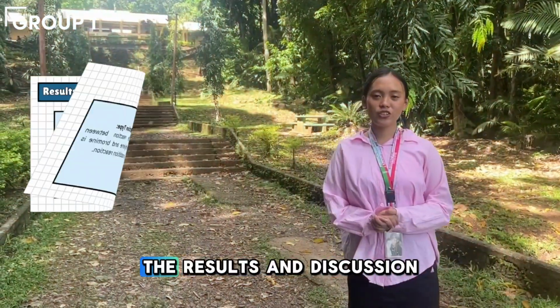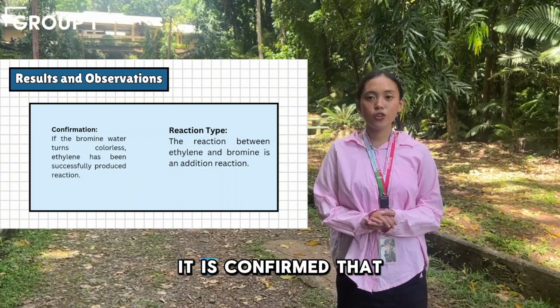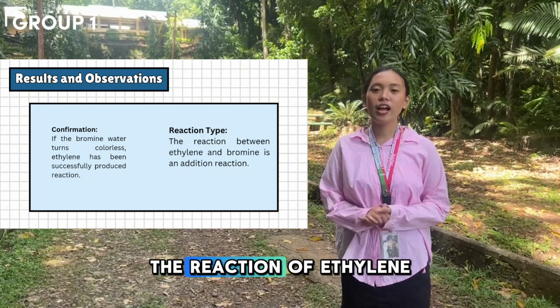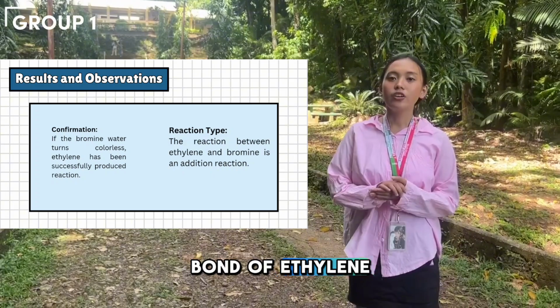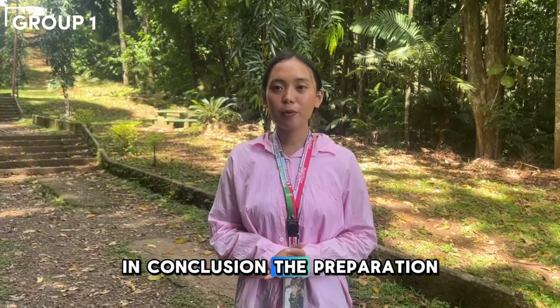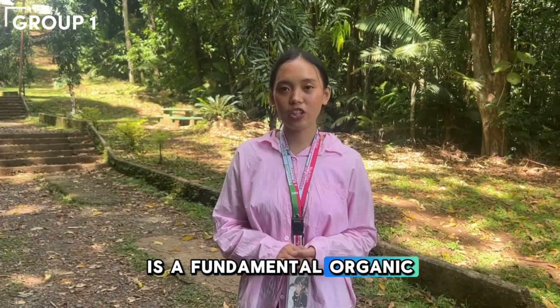Now moving on to the results and discussion. If the bromine water turns colorless, it is confirmed that ethylene is indeed an unsaturated hydrocarbon. The reaction of ethylene with bromine is an addition reaction where bromine atoms add across the double bond of ethylene, resulting in dibromoethane. In conclusion, the preparation of ethylene through the dehydration of ethanol is a fundamental organic reaction.